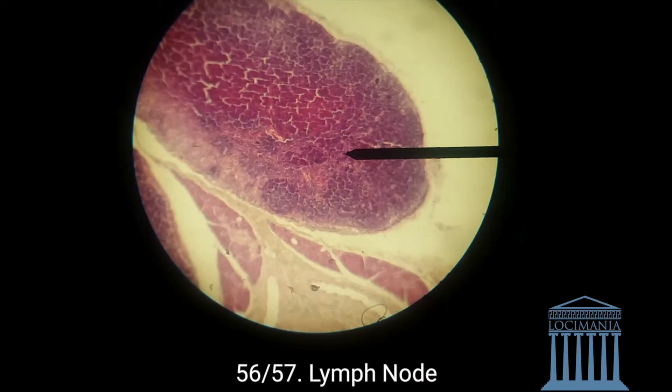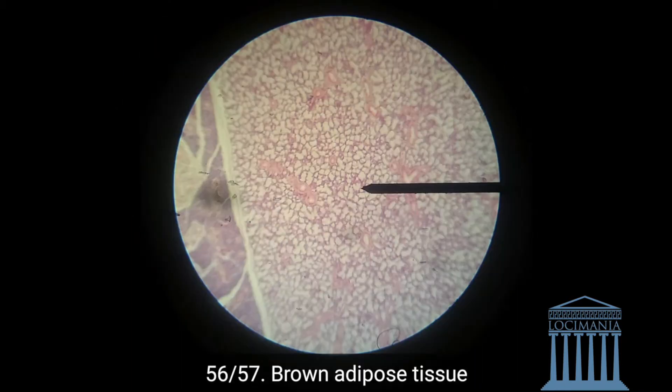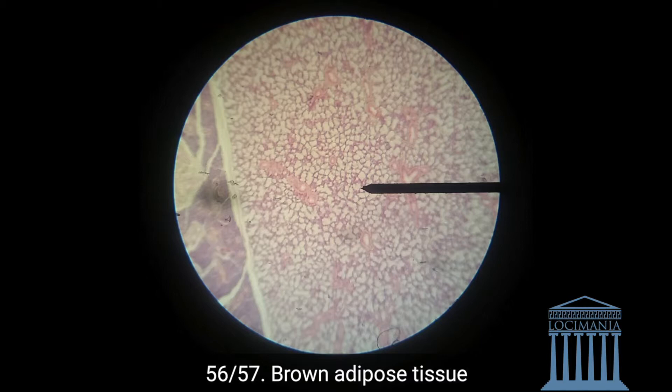Going on to the lymph node, it's really distinguishable. Here's the lymph node with many lymphatic nodules. We also have the white and brown adipose tissue — here's a picture of the brown adipose tissue, and the white adipose tissue you already know how it looks like.